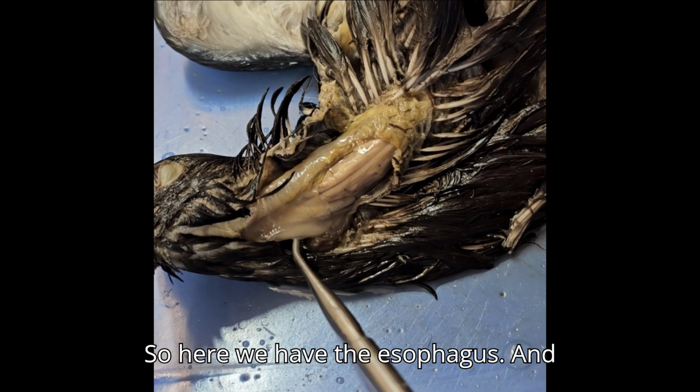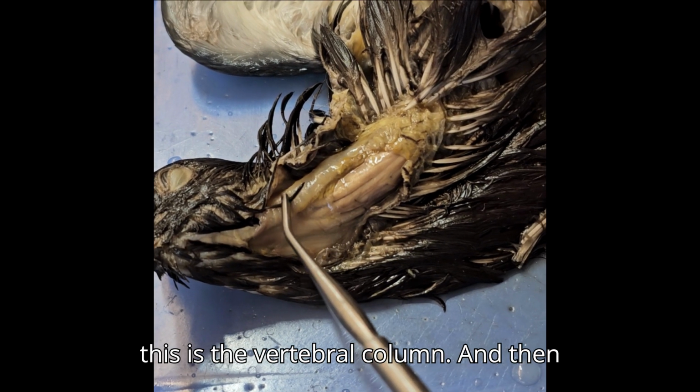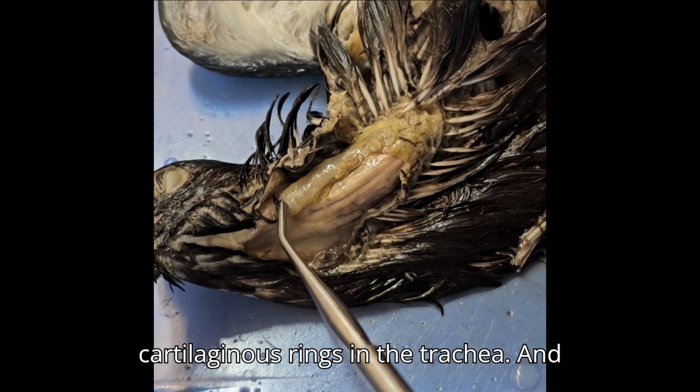So here we have the esophagus, and this is the vertebral column. And then here we have the trachea. You can tell the trachea because of all of the cartilaginous rings in the trachea.